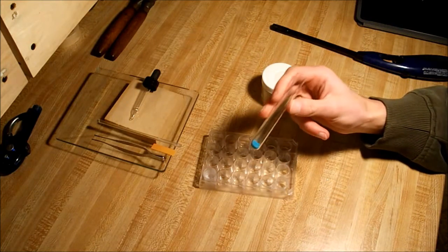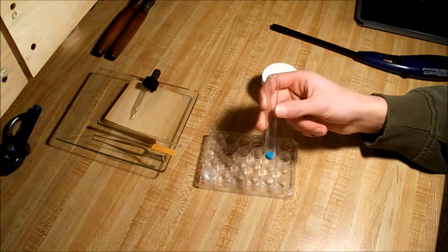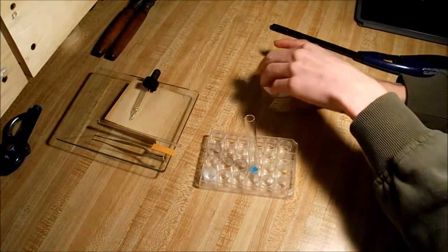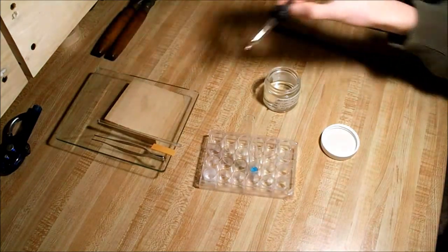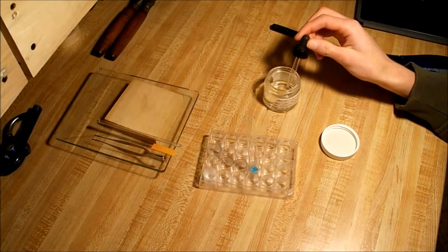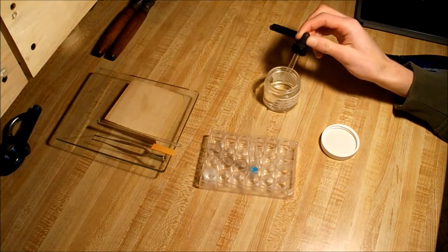Like always I pre-measure my materials. I have about an eighth of a teaspoon above my tube here. And what you're going to do now is add ten drops of hydrochloric acid into the test tube. I would like to warn you in advance that this does produce some pretty gnarly fumes, so you should stand well back.